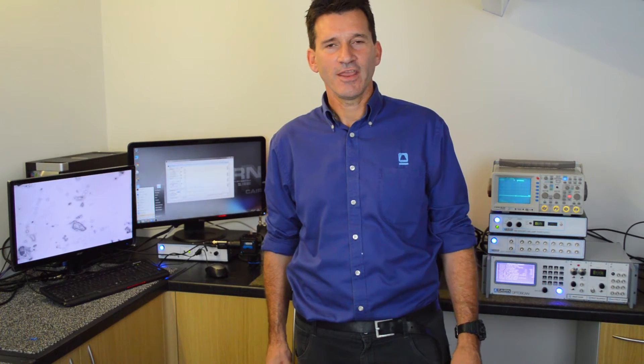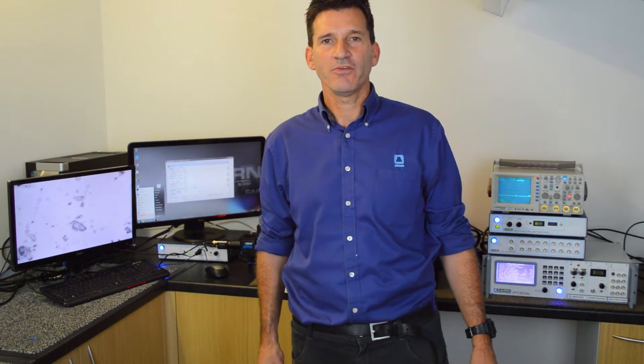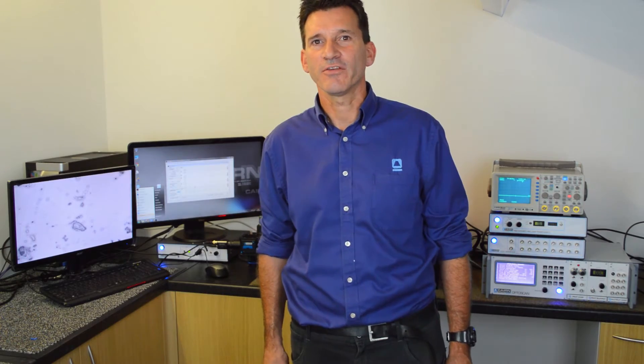I'm Jeremy Graham, Managing Director of Cairn Research. I'm going to talk to you today about our standard photometry system for intracellular calcium measurements and other recordings.